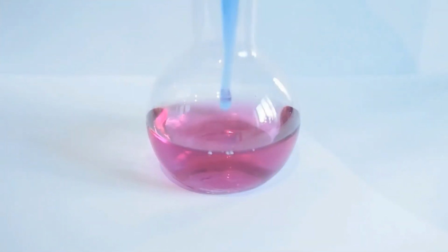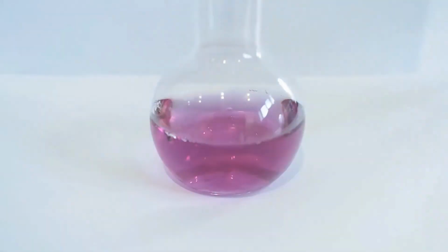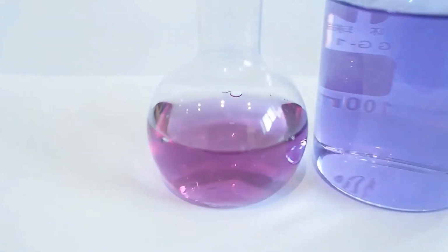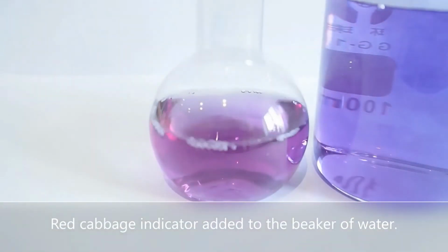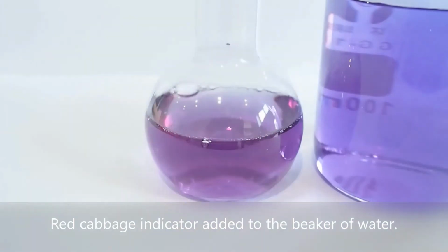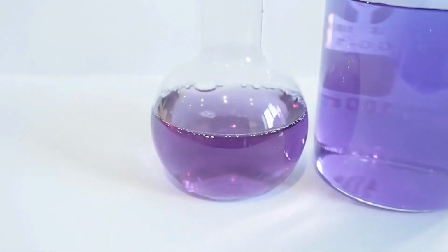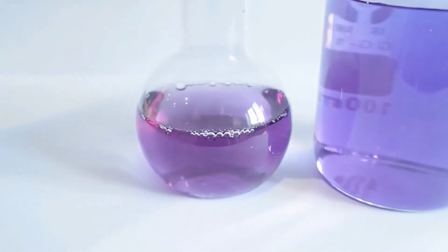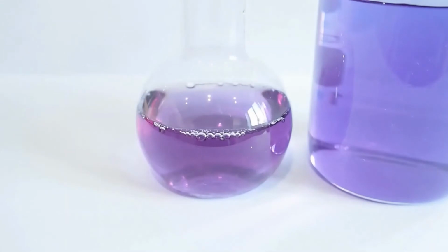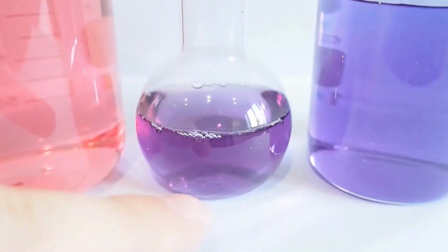Let's speed this up a little bit. We'll be able to see it. You can see that the colour is changing. It's gone from that pinky red to that deep purple of the water, and that's because the base is reacting with the acid and they're both being used up, which has resulted in a neutral purple solution, just like the water sample. You can see it here compared against that red of the acidic sample.